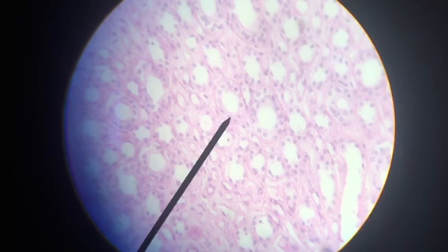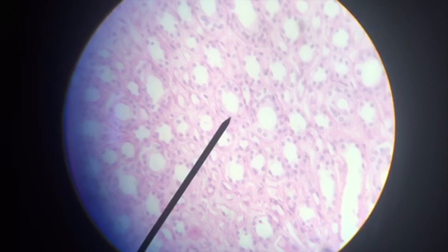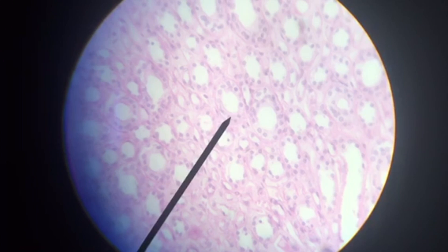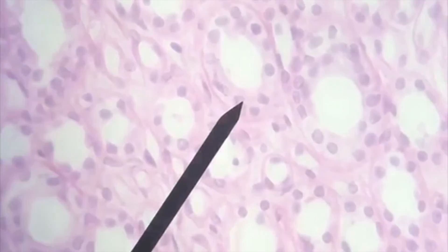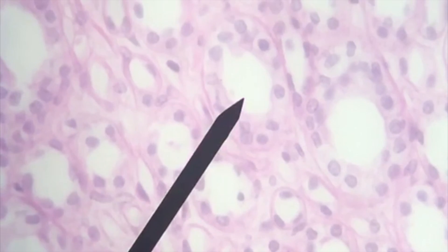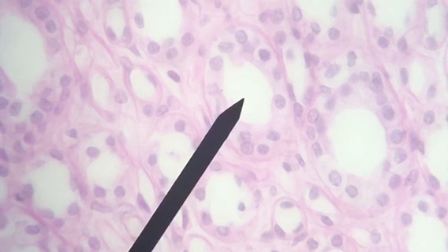Now we're going to remain in our kidney for our next section, and this is going to move and shift to the tubules of the kidney that allow for concentrating of urine. I usually tell my students to look for trigger words that are going to help them visualize where we are and what we're looking at. The word 'tubes' helps us understand that we're in the kidney.